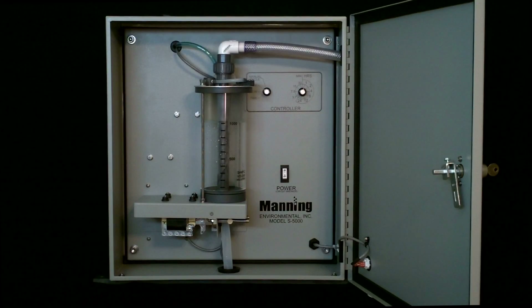Welcome to Manning Environmental help video for pressure switches. Today I will go over the operation and testing of the pressure switch on your sampler. The cycle on a vacuum unit is purge with pressure, draw with vacuum, measure with pressure, and deposit with pressure.